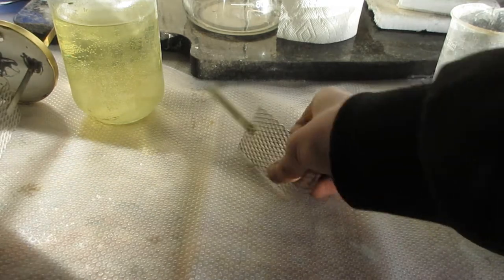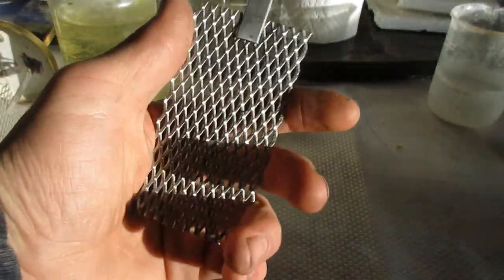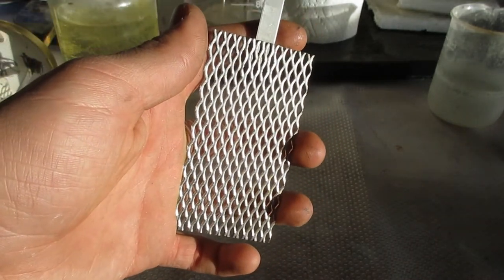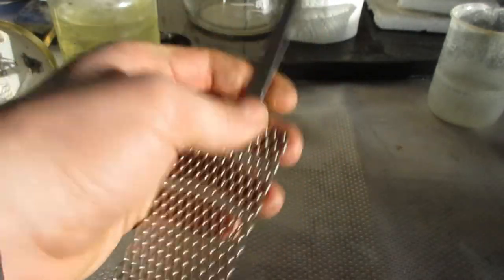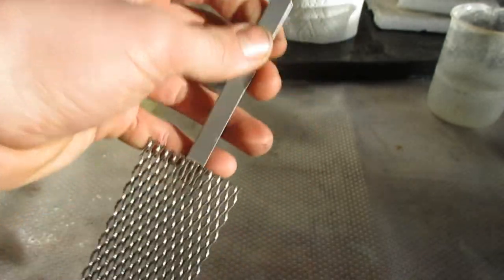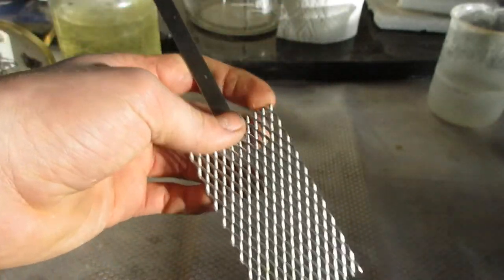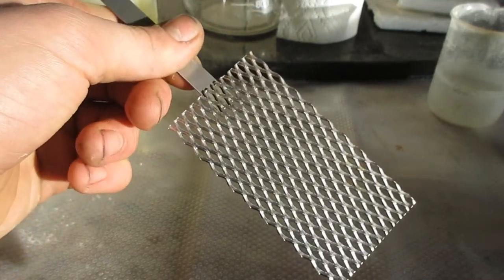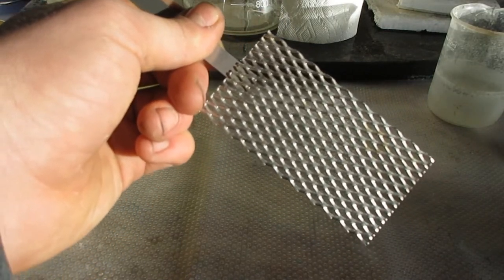All is not lost though. If this is titanium and isn't just some other steel alloy or something, I should hopefully be able to use this as a cathode. And then hopefully I won't have to buy a strip welded to a mesh as a cathode, because I've been having some trouble with that lately for making electrolytic cells and whatnot. So hopefully I should be able to do that. I will definitely give updates on whether or not that has worked.